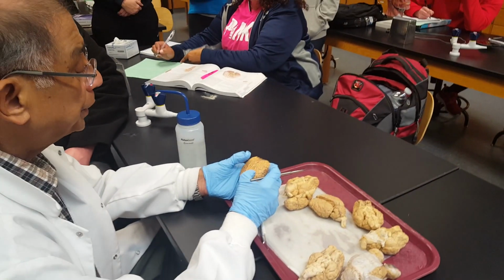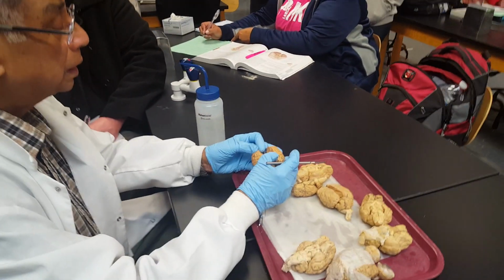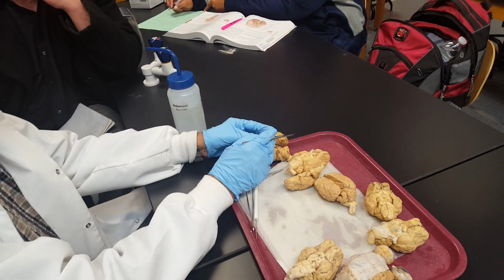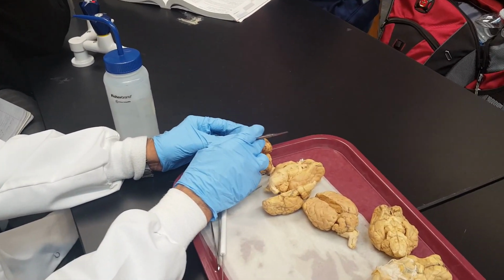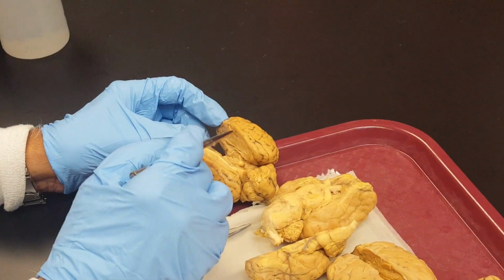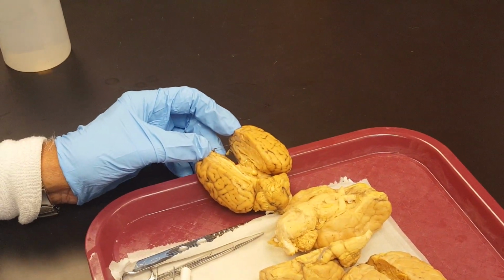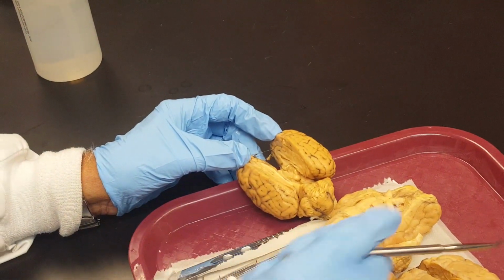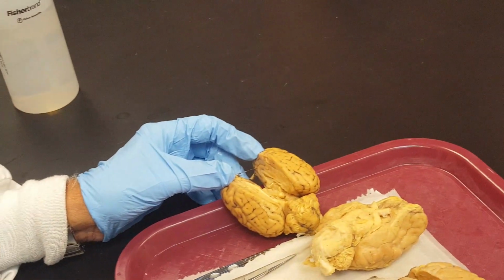And if you cut through, you can find, look here. Certainly, the surface is not transparent, so you cannot see from there. You have to come close. You can see, and I will try to show you on this.